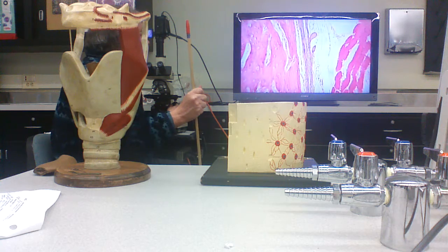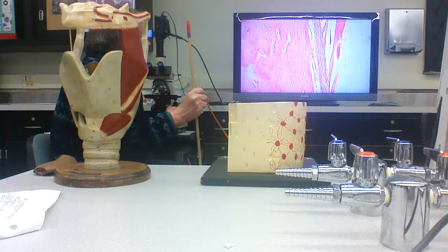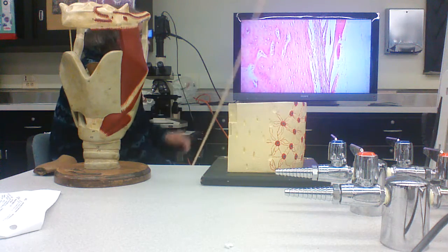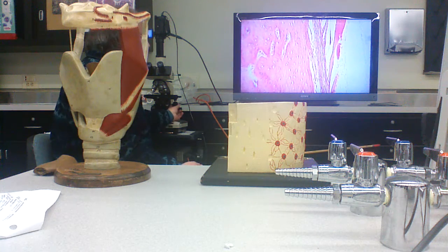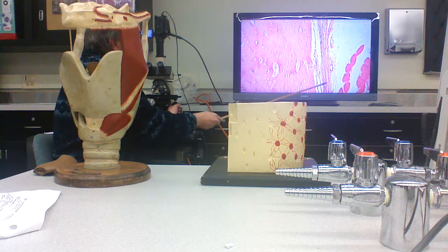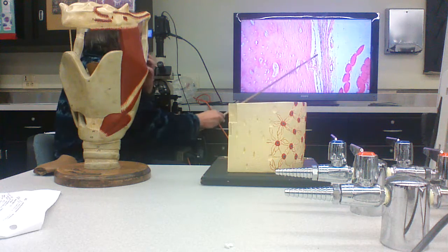Right? But we kind of talked about that in terms of the muscle bone joint. You know, you have muscle connected to dense regular connective tissue, right? That interlaces with the fibers in the periosteum, and then periosteal fibers that interlace with the bone matrix, right?